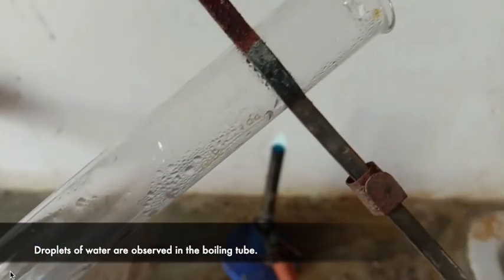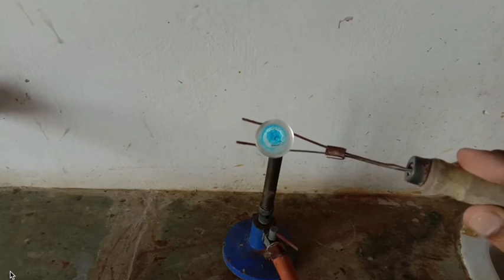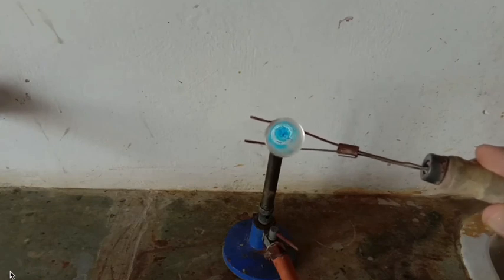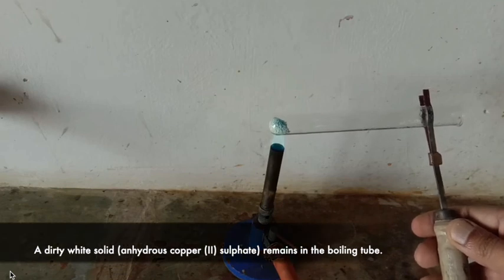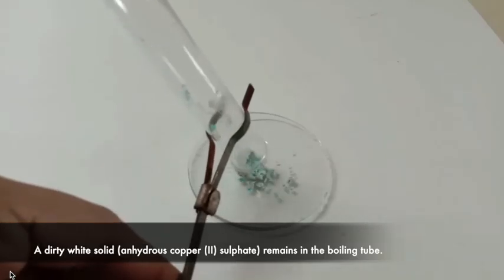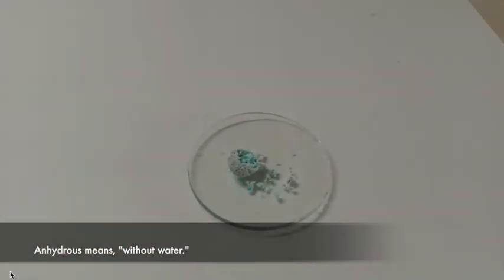A dirty white solid remains in the boiling tube. This substance is anhydrous copper sulfate. Anhydrous means without water.